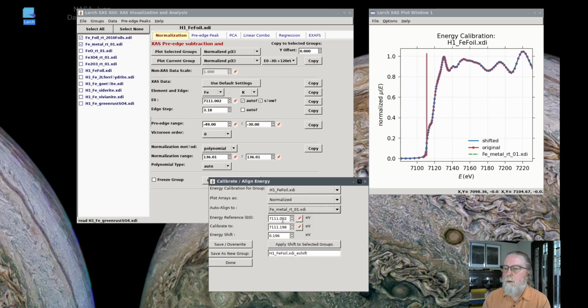So I'll auto align it to iron metal foil. That shows here the original and the shifted, and those two now line up very well. It's hard to see that they're different. They are. Those are different spectra, but they align very well. So I could save this as a new group, say H1 foil energy shift. I'll do that right now.